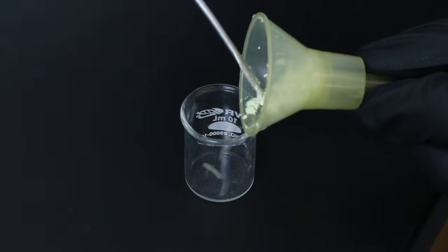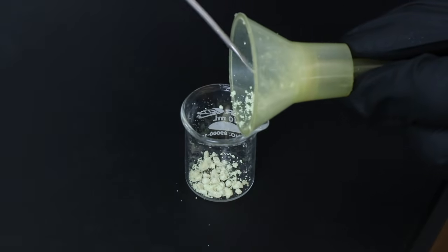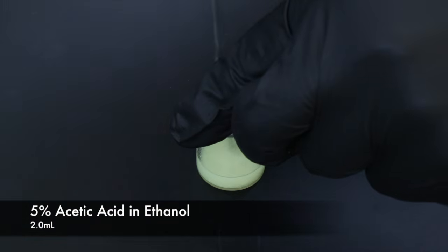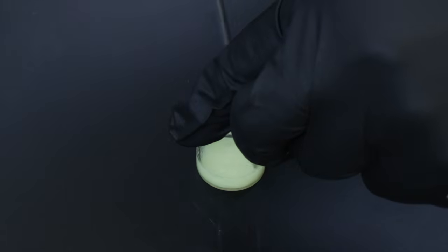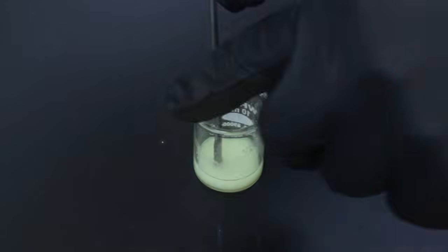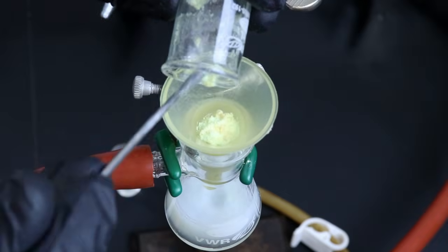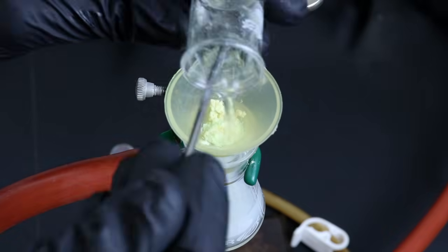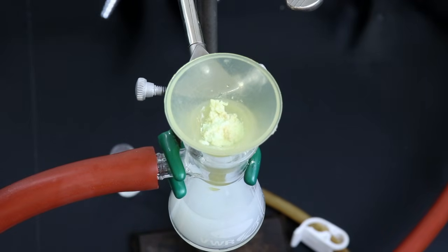Once it's dry enough, it can now be moved over to a beaker where I'll be adding 5% acetic acid and ethanol to react with any remaining base. And I want to make sure to stir and break up the solid so that it interacts with the acetic acid as much as possible. Then I'll place it back into the Hirsch funnel and rinse that solid a few more times with some more distilled water.